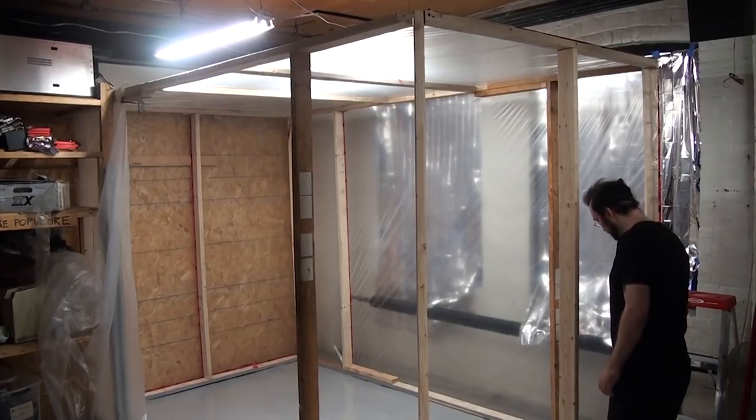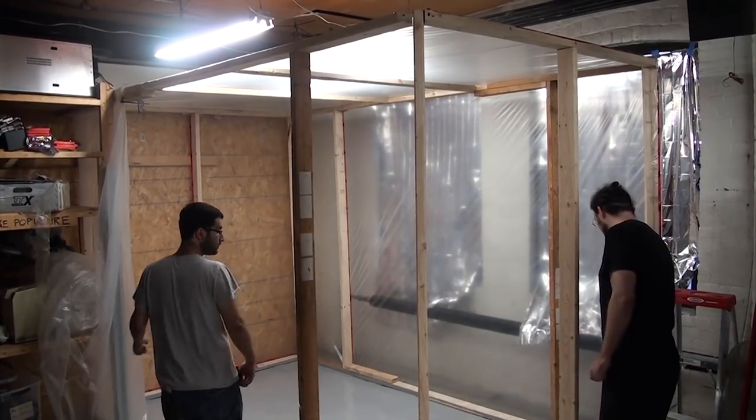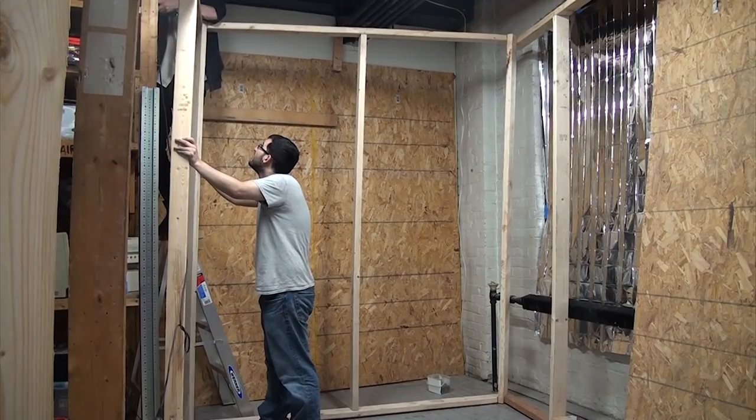Since the lab will be tucked away in a corner, we knew that we couldn't build it in its final position or we wouldn't be able to get the back two walls covered in plastic. So we cut the rest of the pieces for the longer walls, then assembled the frame with the intention of sliding it into place once some of the plastic was up.